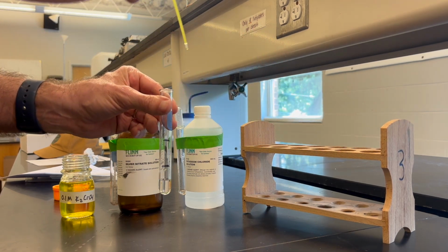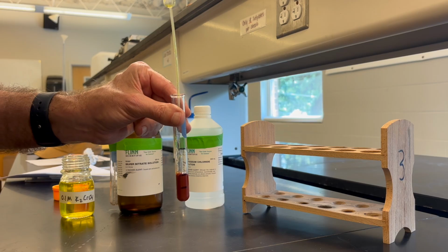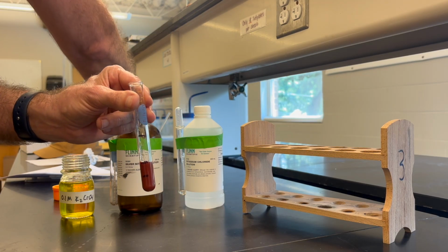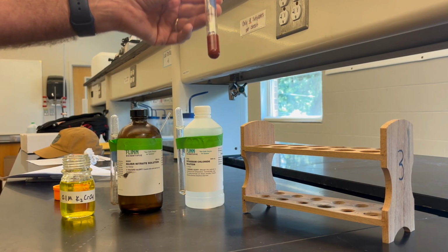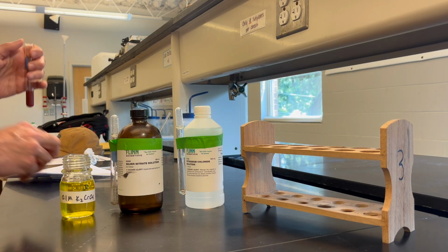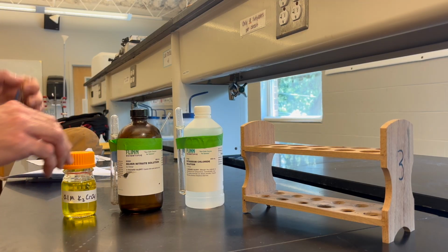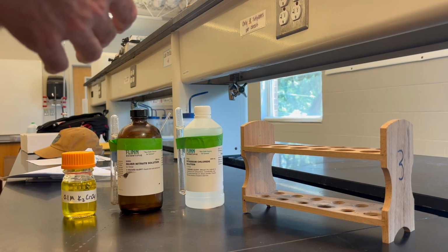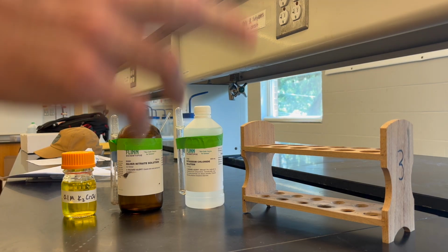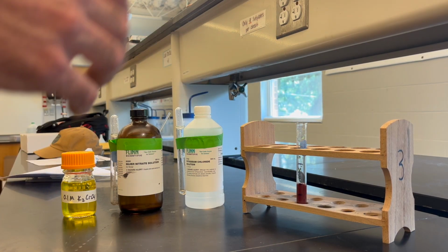So I'll have my 2 milliliters of silver nitrate in there, and then I will put the potassium chromate in. And you can see that that forms a nice, very cloudy, reddish brown precipitate in there. And that's great as they think about what KSP means, or just plain old solubility rules. You get a great precipitate there. You can let that sit, and that's another benefit of having two test tubes. They can let that one sit and see the solids settle out. It settles fairly quickly. It might even settle significantly here while I'm doing this demonstration.